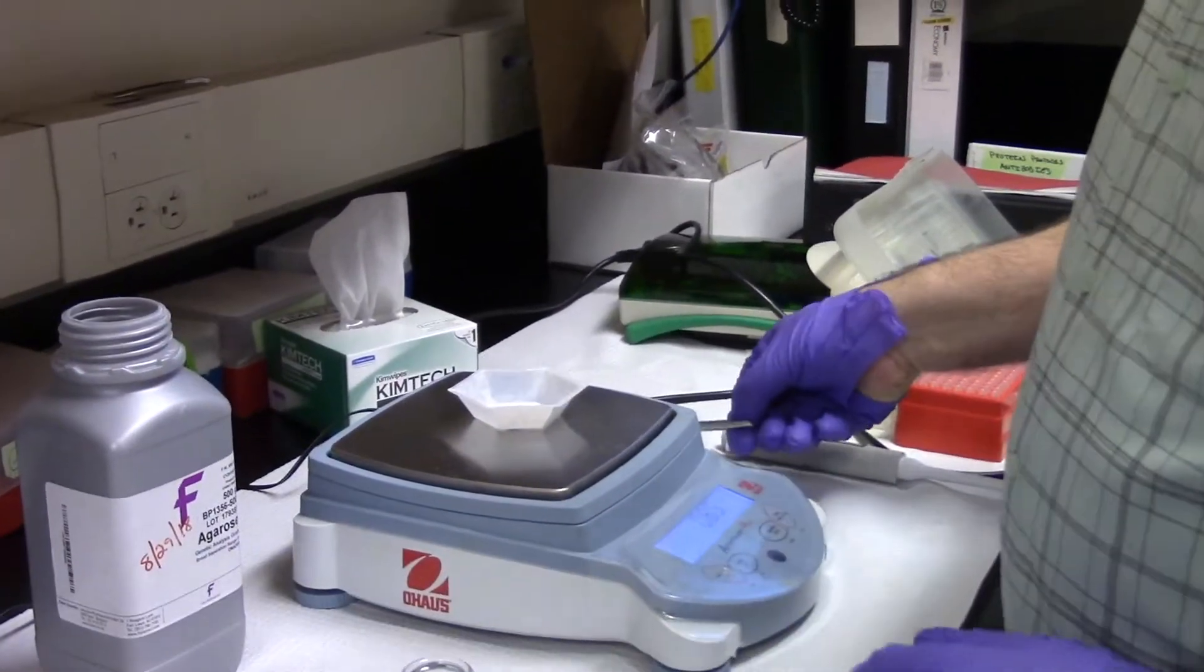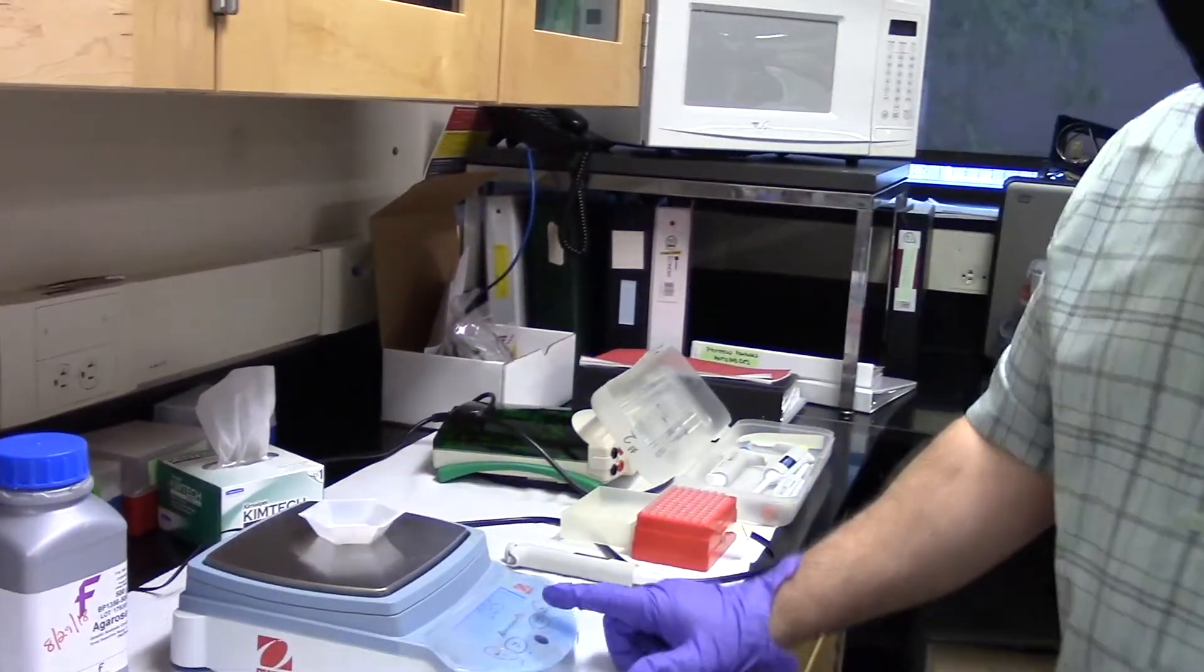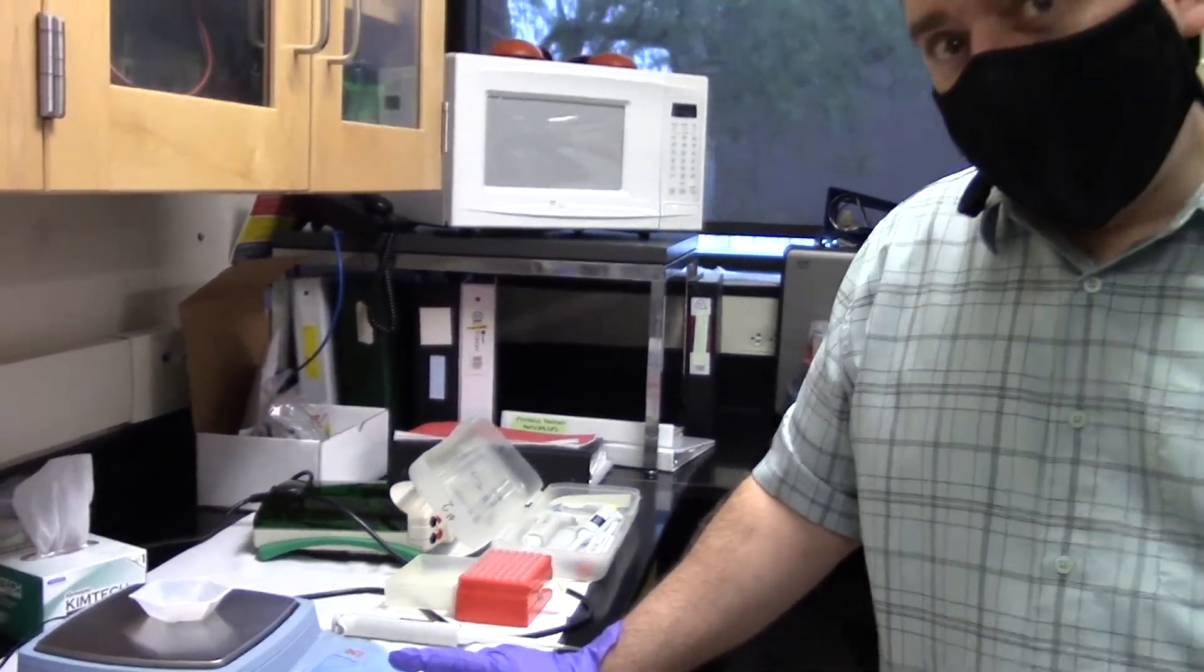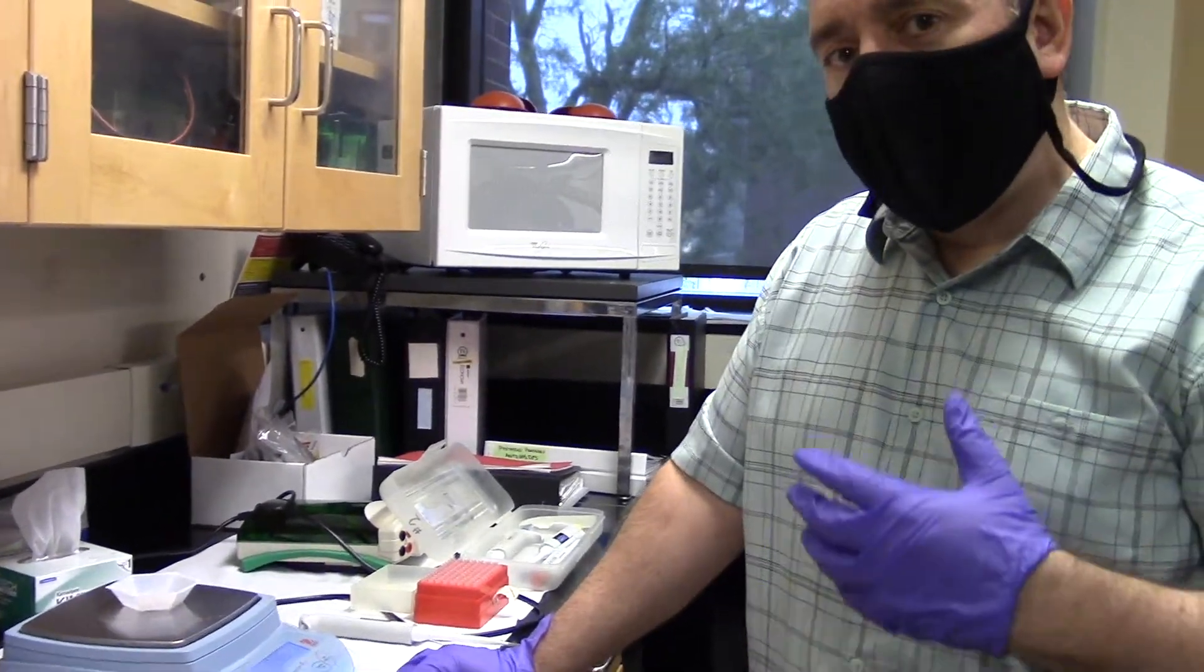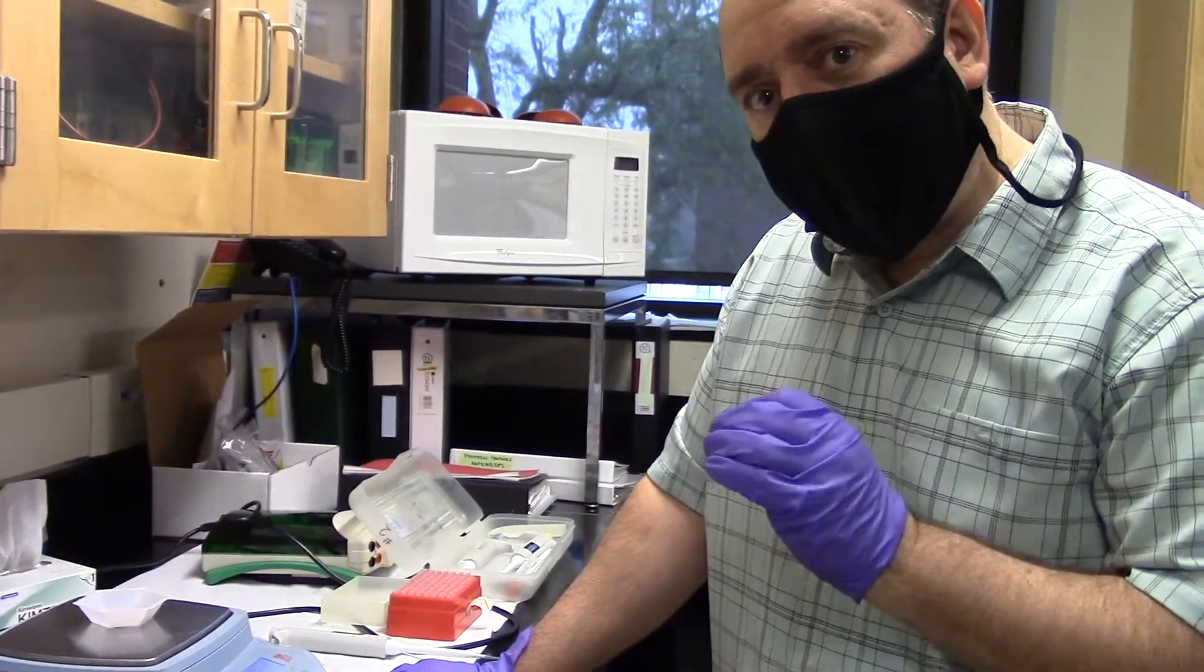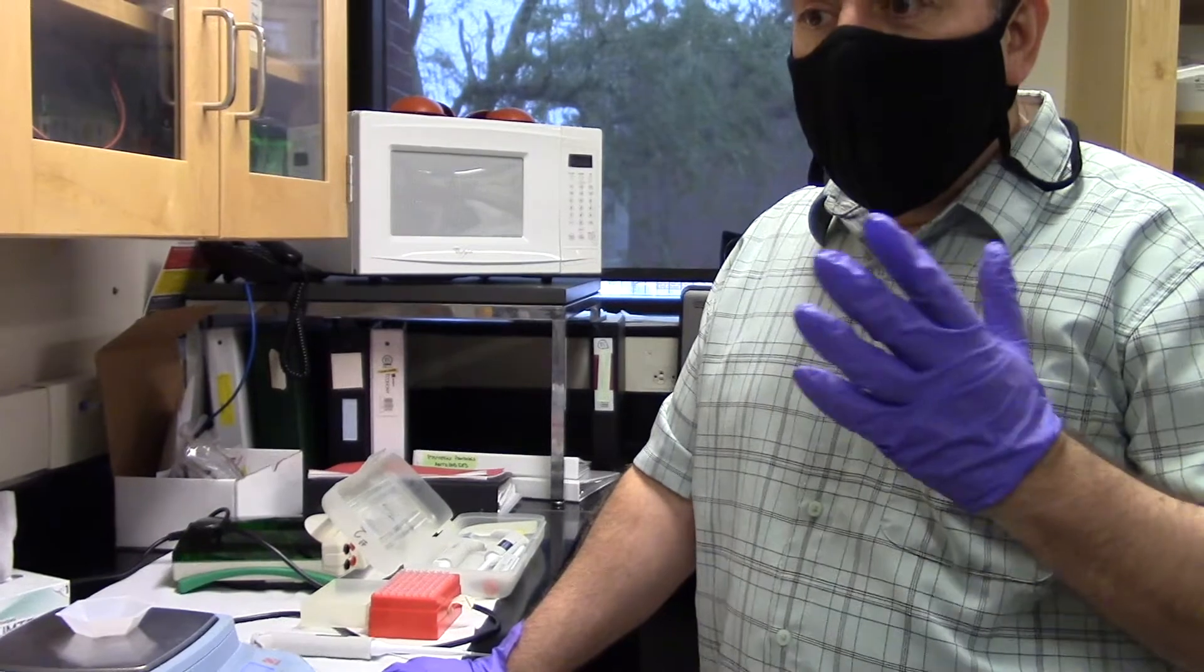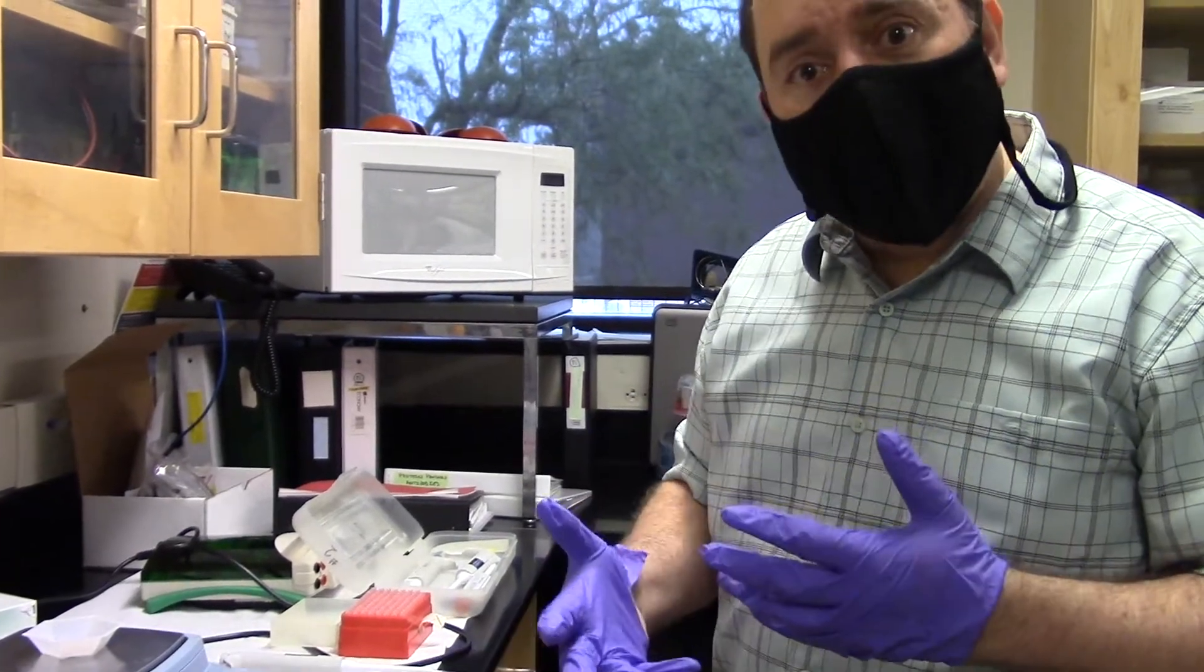Notice that this is a biology class, not a chemistry class. So I got 0.85 when I was looking for 0.8. I'm looking to make a solution of about 2%. And then the DNA is going to move through this agarose solution once it's solidified based on how thick the solution is.